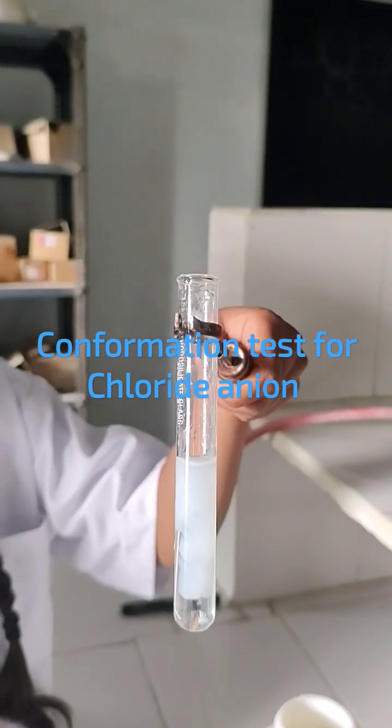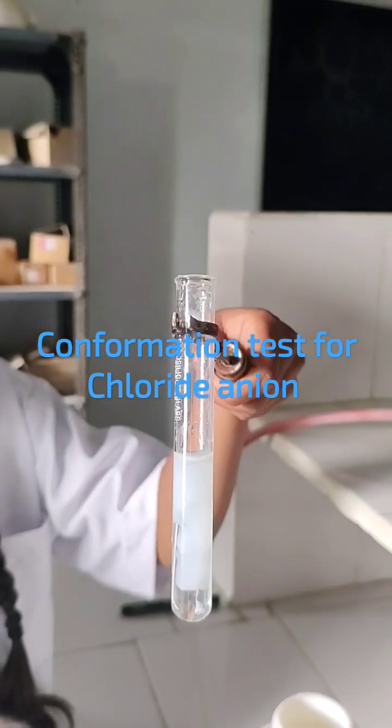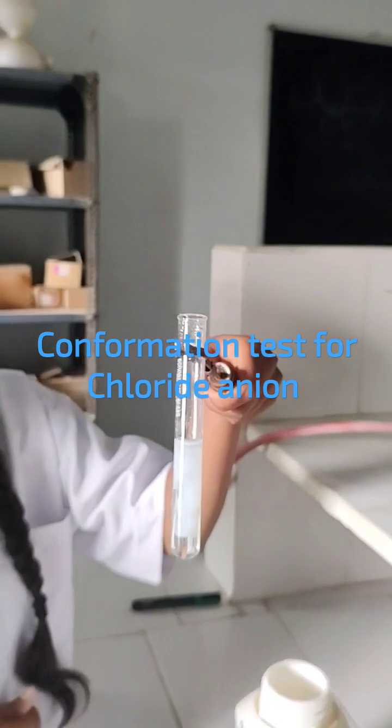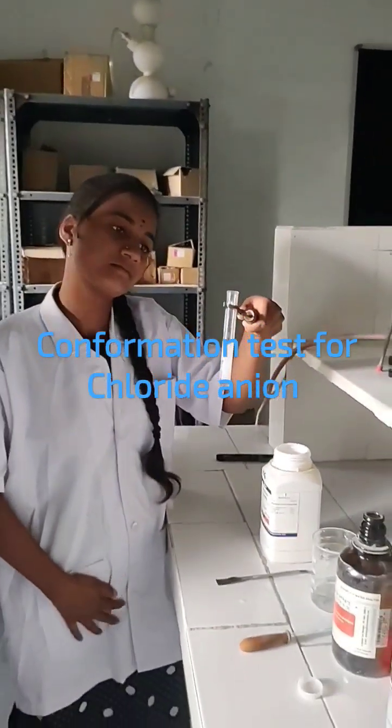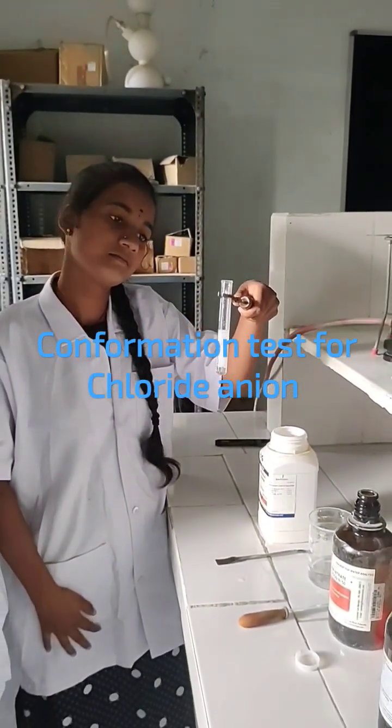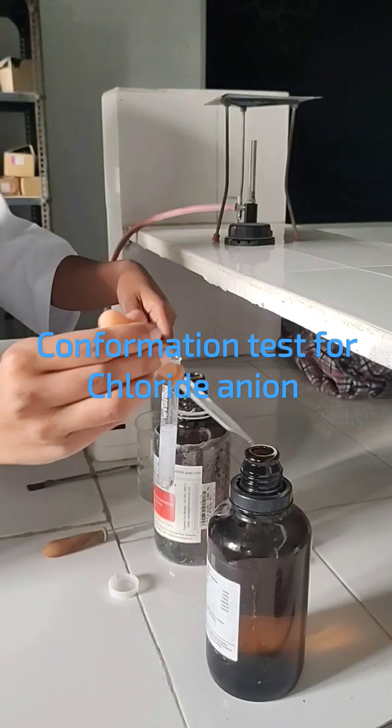If this curdy precipitate is dissolved in the ammonia solution, this indicates the presence of chloride anion in the given salt.